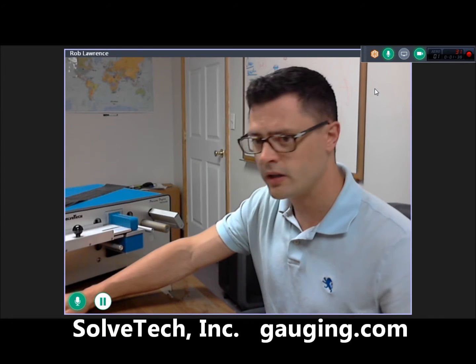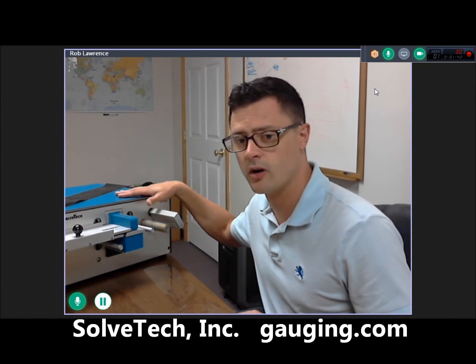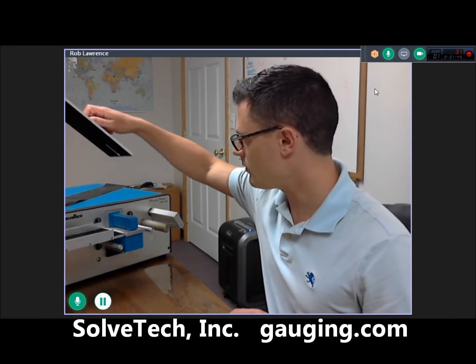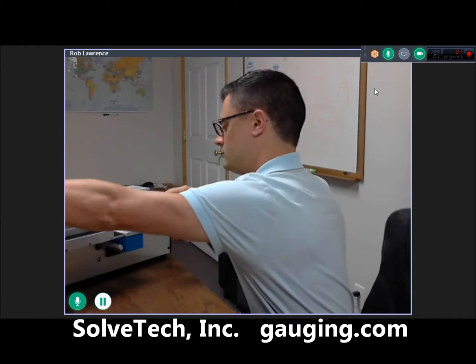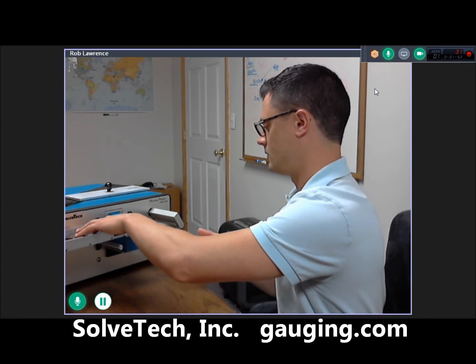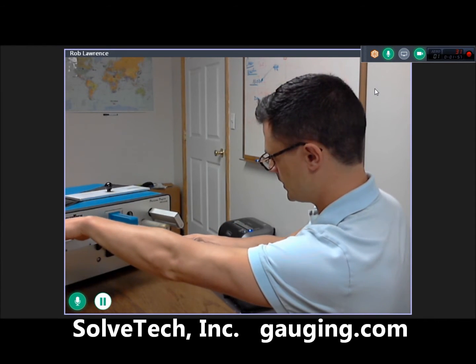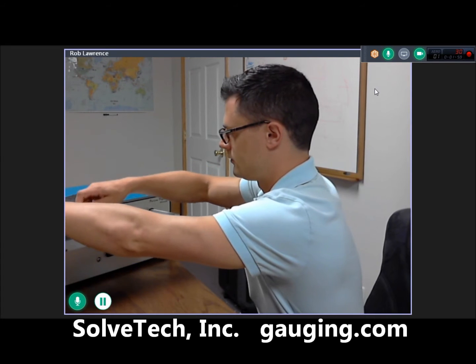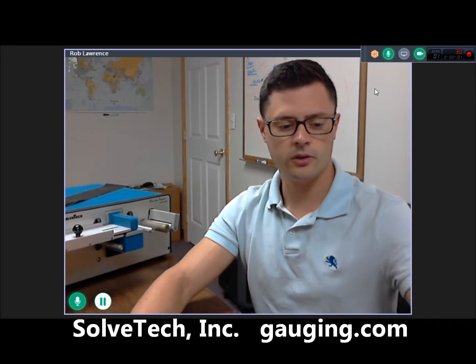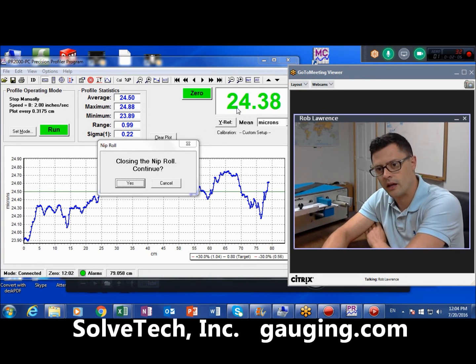So looking past this, there's the option of going to a non-contacting thickness gauge, and this is what we offer here at SolveTech. So we'll go ahead and put the film in. It just loads in like that, and this device is designed for profiling. So you can see right here that we're measuring the thickness of the film, and we're measuring it with much higher precision, down to about 0.025 microns.